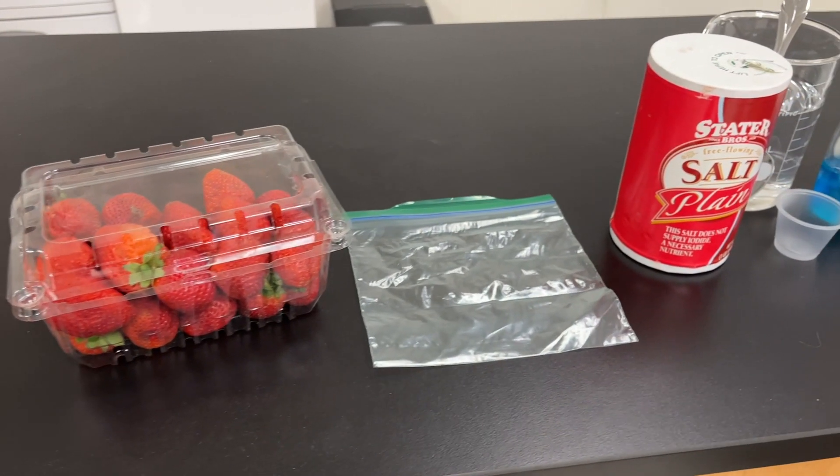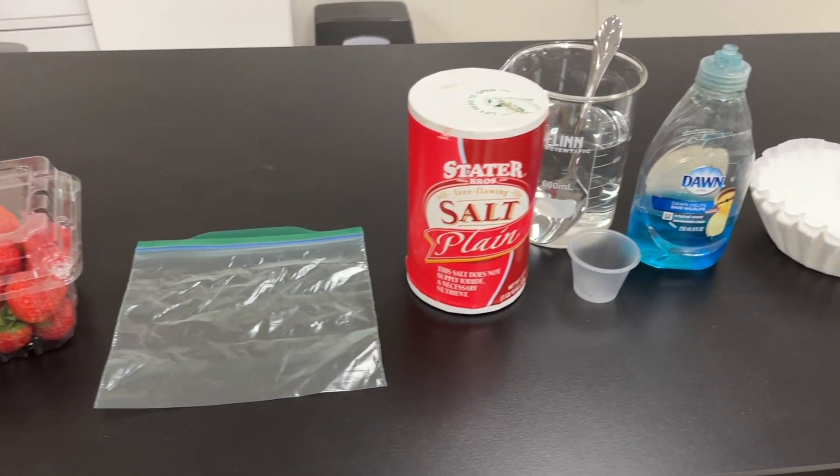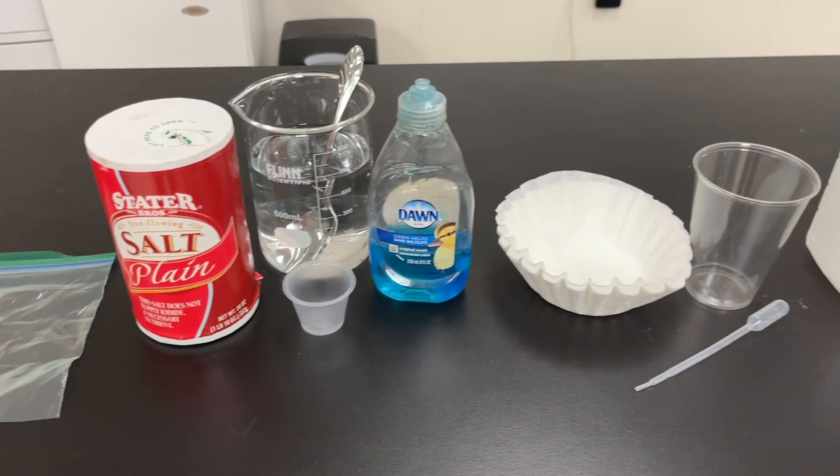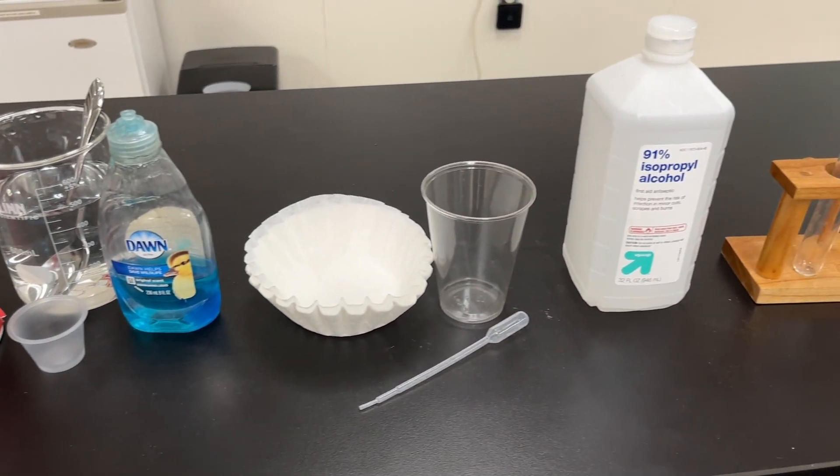For this lab you will need some strawberries, a ziplock bag, salt, dish soap, water, a coffee filter, plastic cup, pipette, rubbing alcohol, and a test tube.